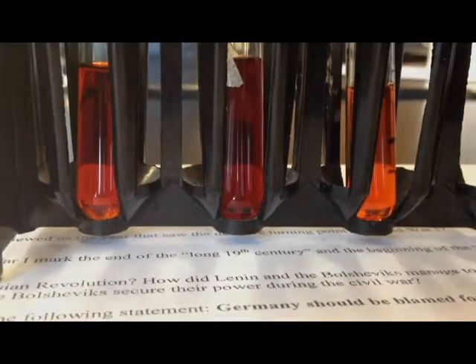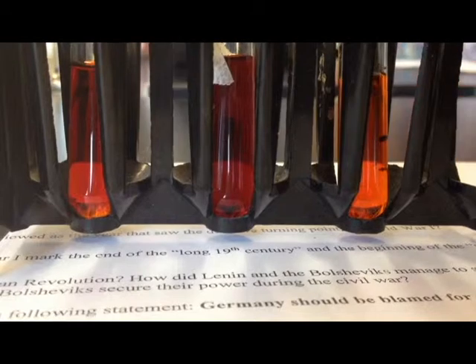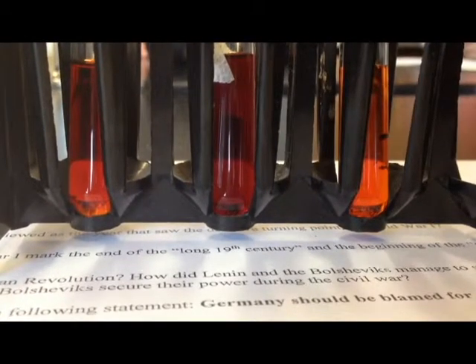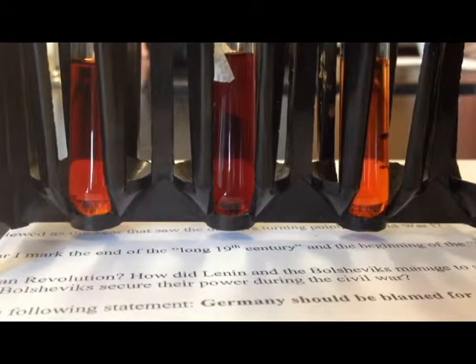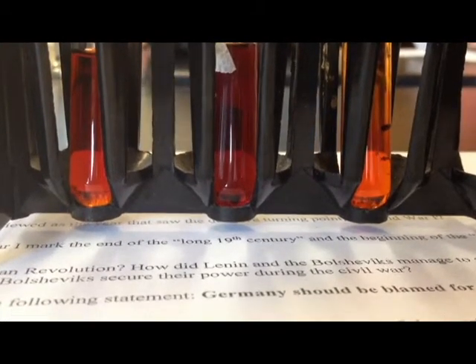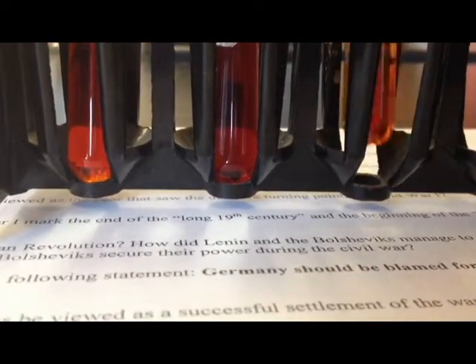To the third test tube, we added 20 drops of distilled water. We used this tube as a reference tube to compare the color changes of tubes 1 and 2. In the pictures shown previously, the tube on the left serves as this reference tube.